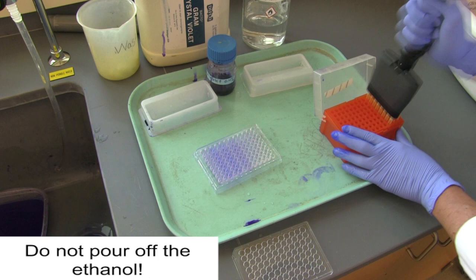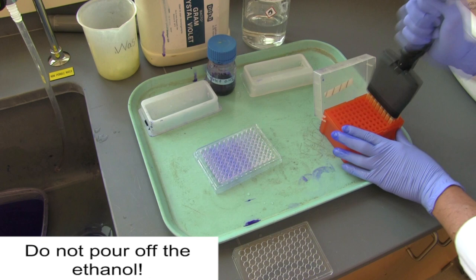Do not pour out the ethanol. This is what you're going to measure with a spectrophotometer in the next step. And now you're done.